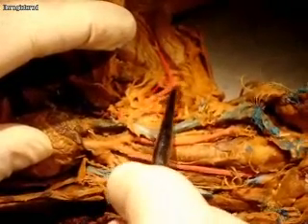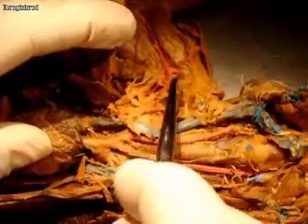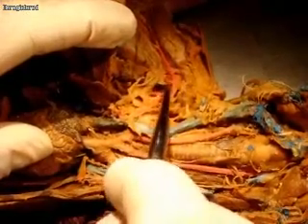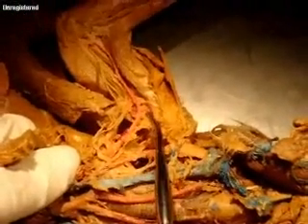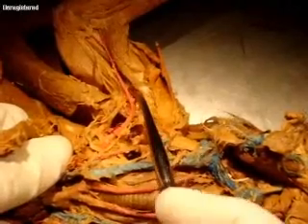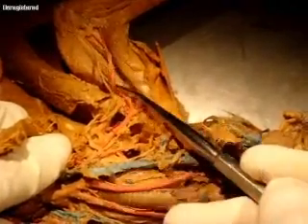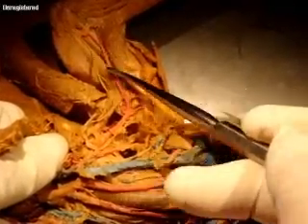The axillary artery has a branch that should go up — this one's going down. Is there a branch that goes up on the other side? Here it is, right there. This is the subscapular artery. And then this continues as the brachial artery here.